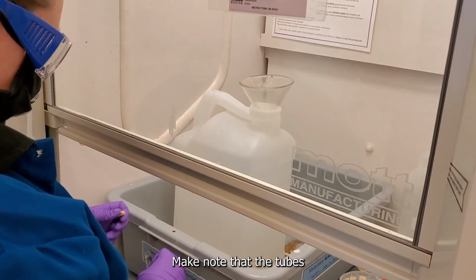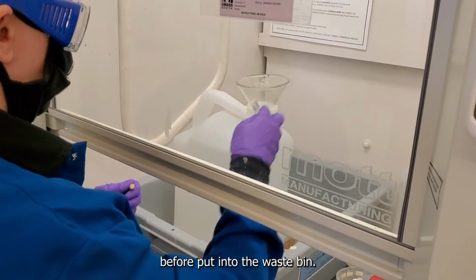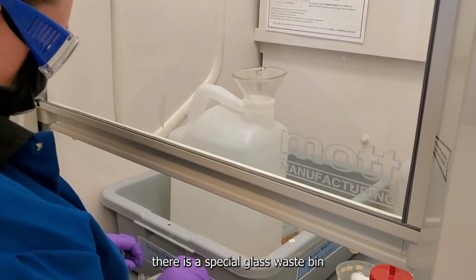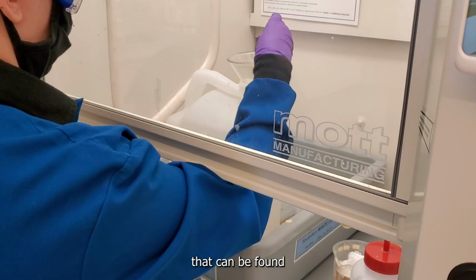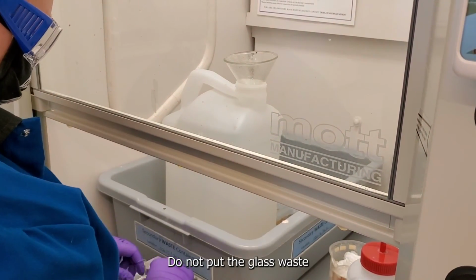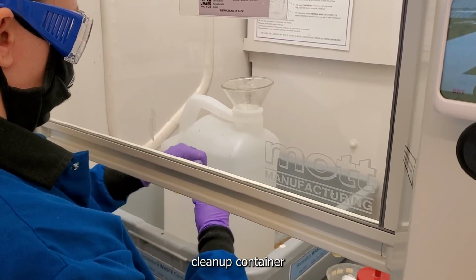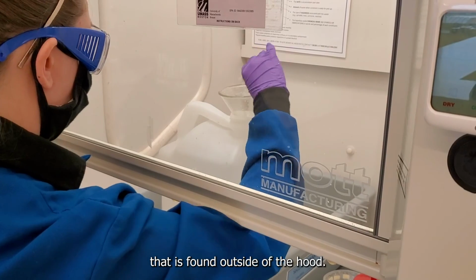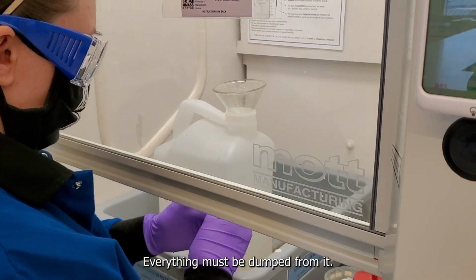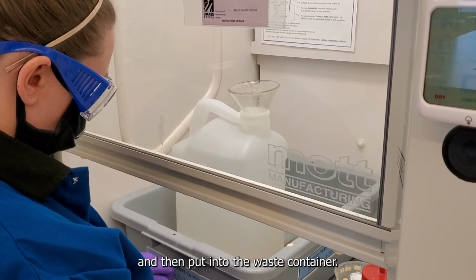Make note that the tubes should be rinsed with acetone before being put into the waste bin. For this lab, there is a special glass waste bin that can be found in the front of the lab. It is in the hood. Do not put the glass waste in the typical glass cleanup container that is found outside of the hood. Remember, everything must be dumped from the glass, rinsed with acetone, and then put into the waste container.